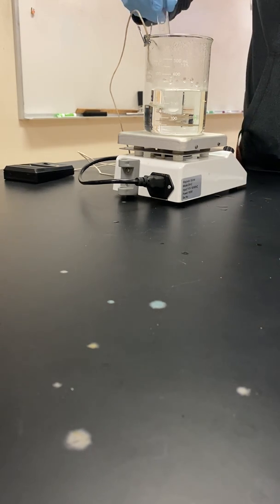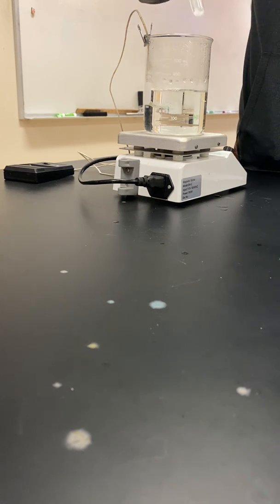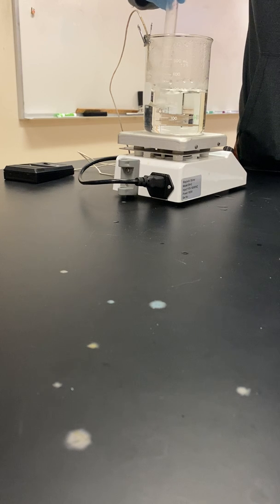So we're going to completely dissolve these crystals. And you can see that I'm just swirling the mixture.